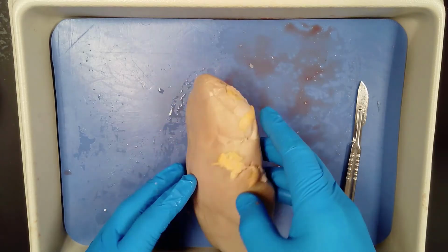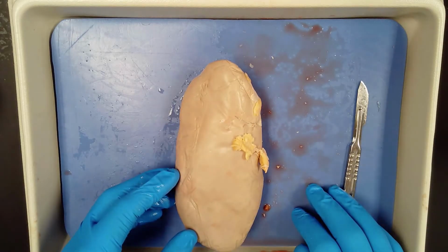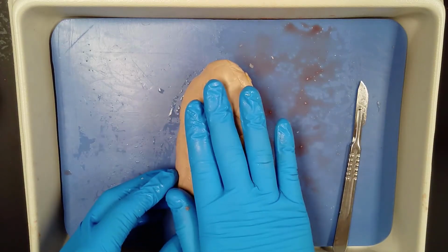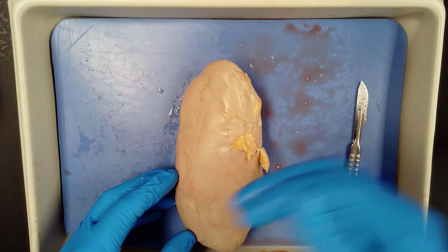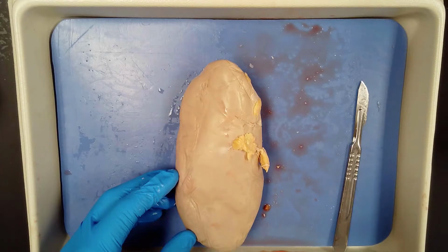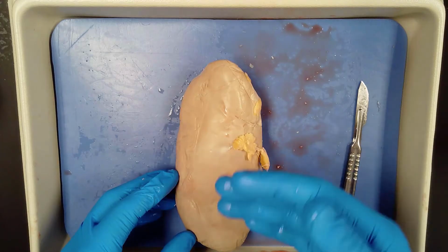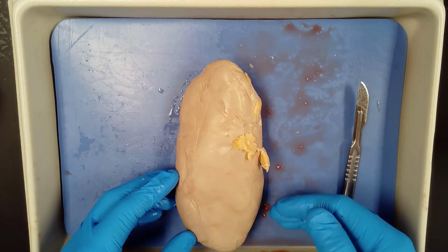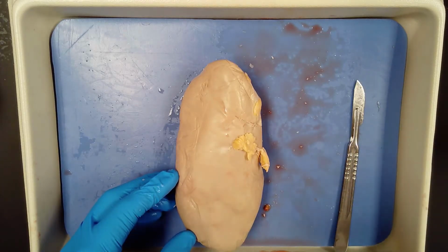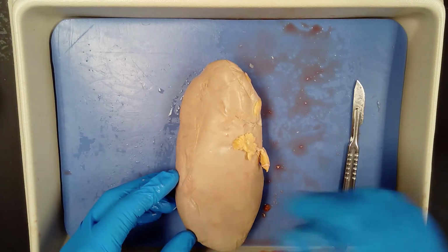Okay. The renal artery, remember, delivers unfiltered blood with waste and other byproducts and excess water into this kidney. So remember, the kidney is filtering that blood as it comes in. That renal artery brings it in. It goes through the filtration process, and then you have what we call filtration, then reabsorption of what we actually need, and then secretion into the bladder of the stuff that we don't need. So some of that metabolic waste. The renal vein transports the filtered and purified blood out of the kidney. So this is really blood in, blood out, and then waste goes out of the ureter.